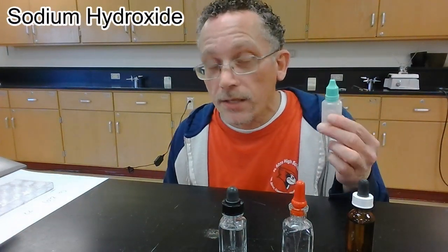Now if you look at your handout, the tests for calcium and zinc both involve adding sodium hydroxide. And either way, you should get a white precipitate. But if we keep adding sodium hydroxide, if we were looking at zinc, that precipitate will eventually redissolve. And if we're looking at calcium, it will not redissolve. So we're going to see a white precipitate either way, and we want to determine, will it redissolve, and we have zinc, or will it not redissolve, and we have calcium.